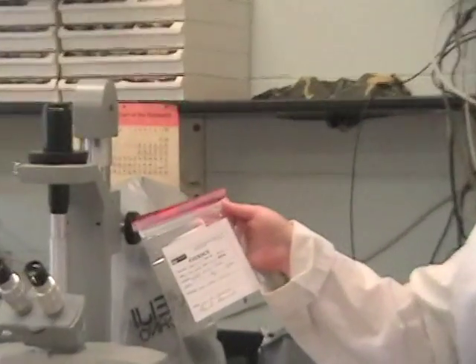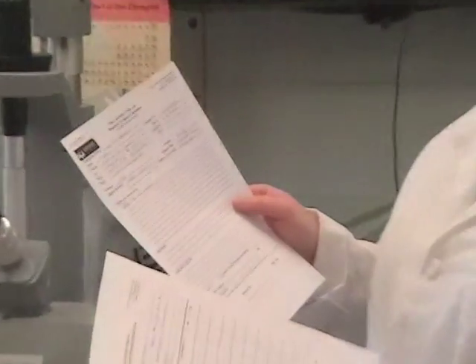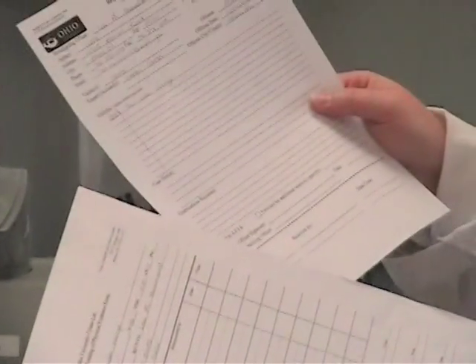Today we will be analyzing bullet casings as well as bullets. The common process in crime labs is to pass off evidence in evidentiary bags, as well as common requests for evidence examination forms and receipt and tracking of forms. These are important so that you can track items through the lab and we know who has touched each item.